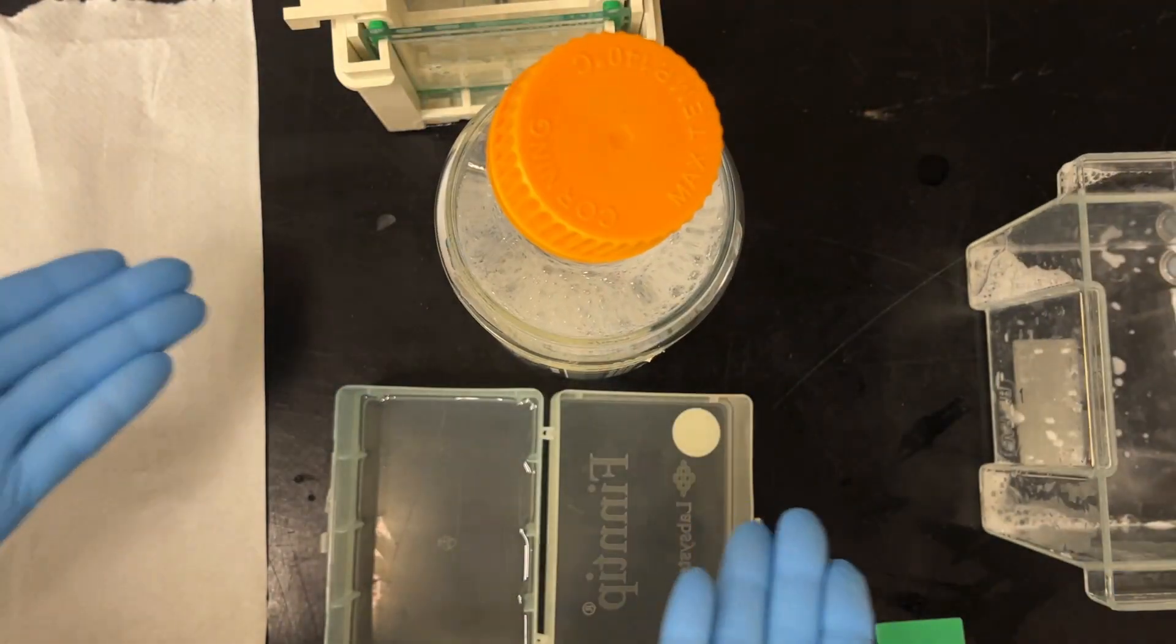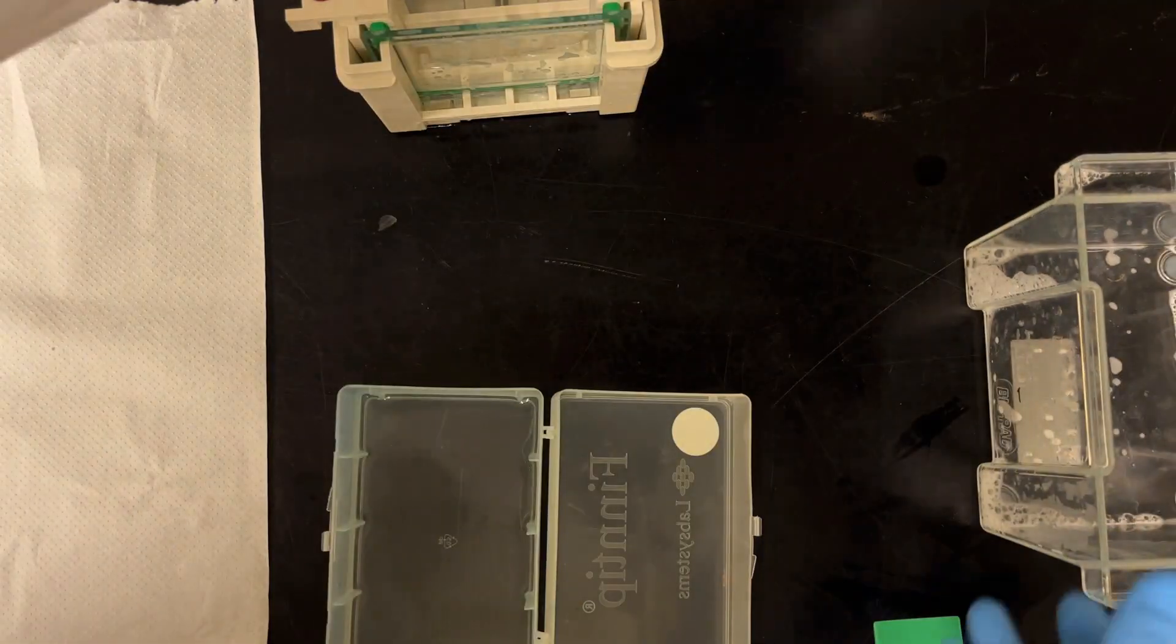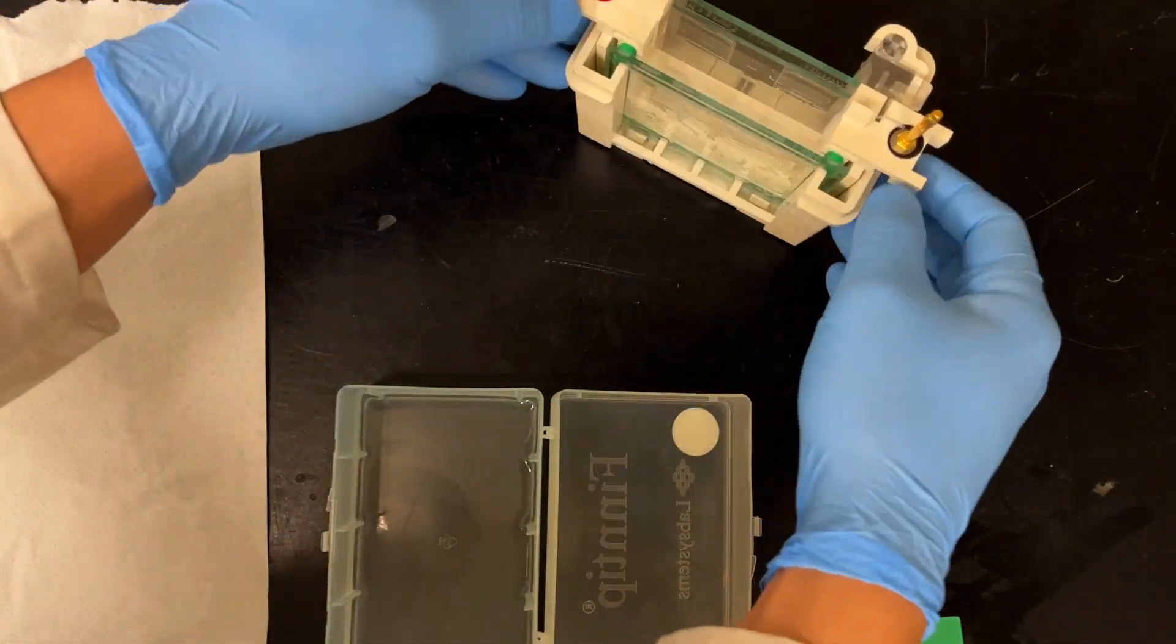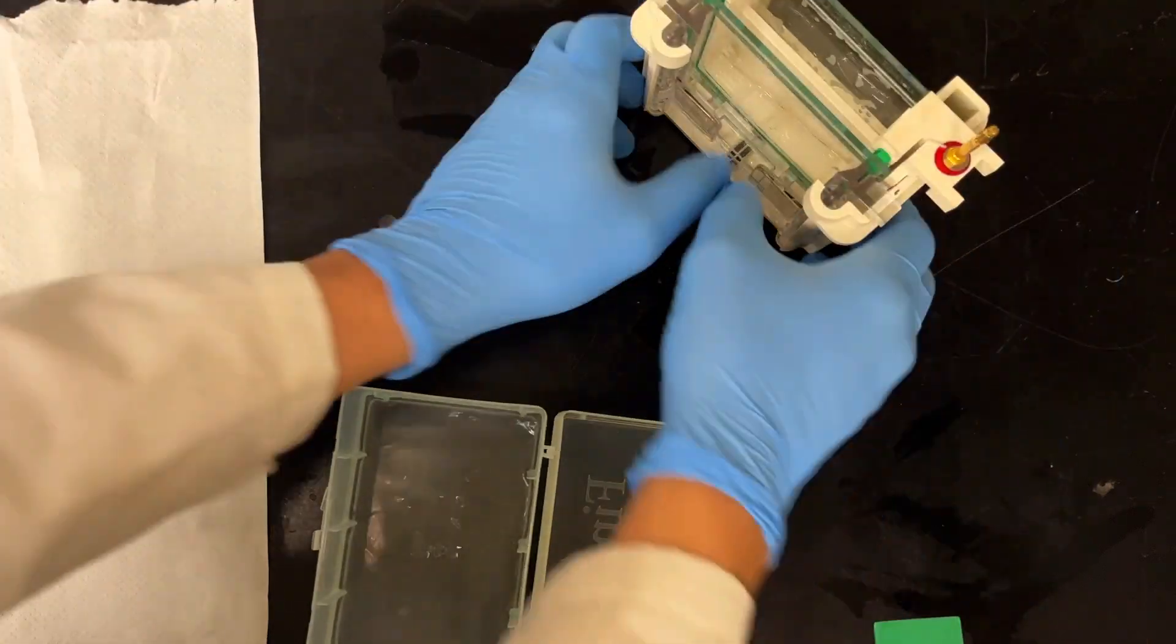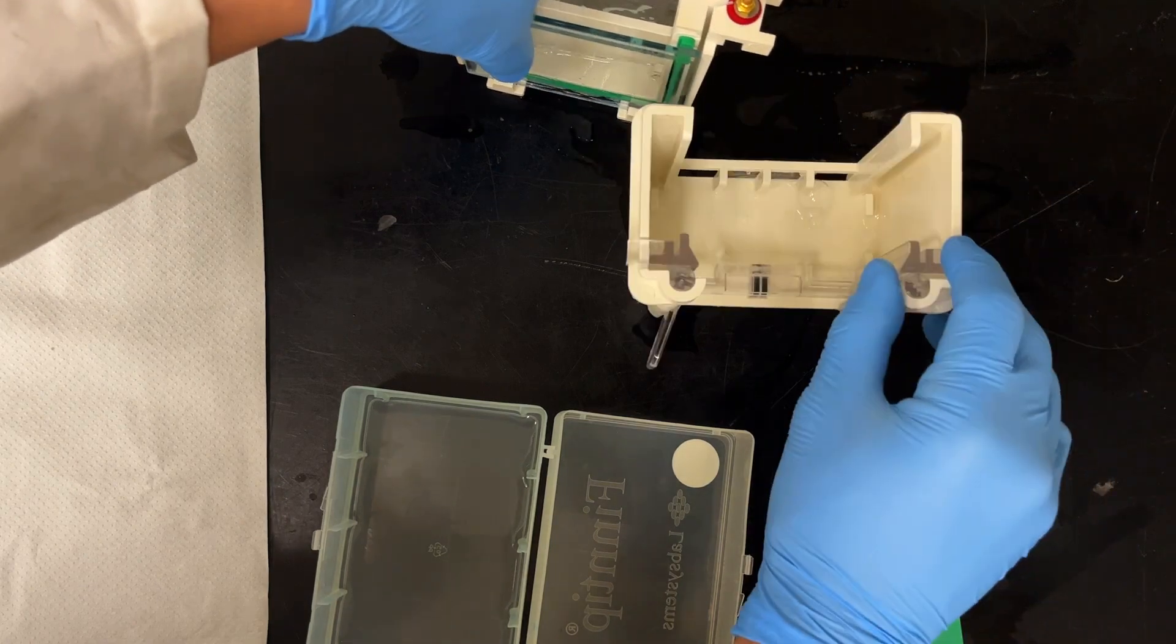So we simply pour that in there and then, yes, celebrate everything. So we put that away and then pull out... oh, why did I do that? Oh, that's right. I forgot. Got to open the clamps and then take out my two gels.